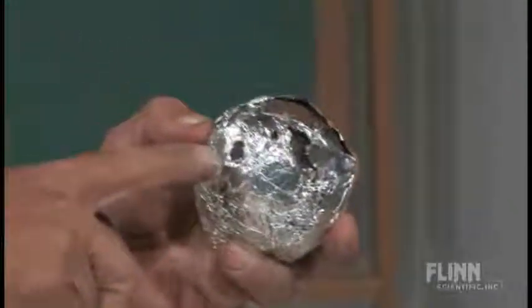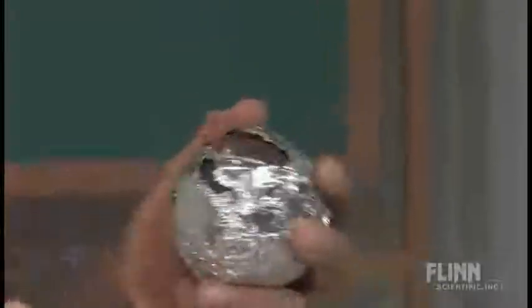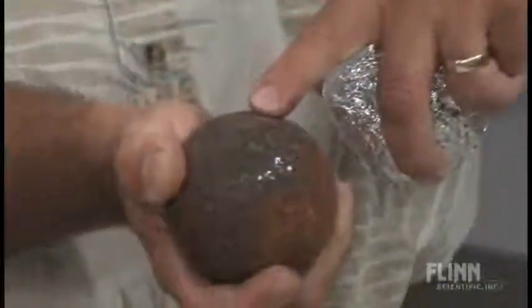You can see I've used up parts of the aluminum here, and parts of the iron oxide here, but of course this will continue to rust, and I can always get another piece of aluminum foil.